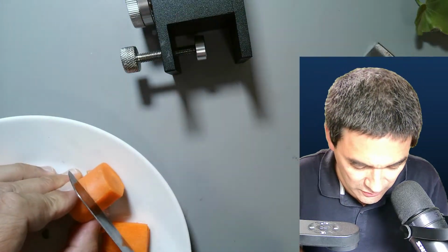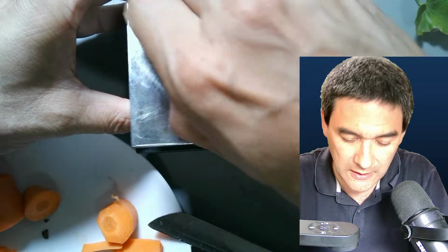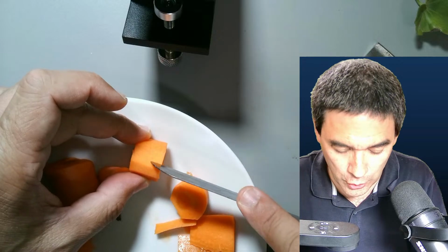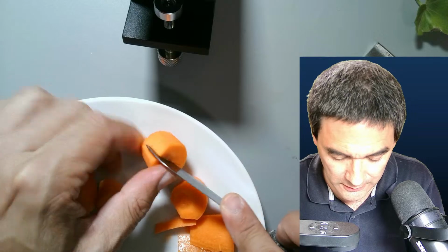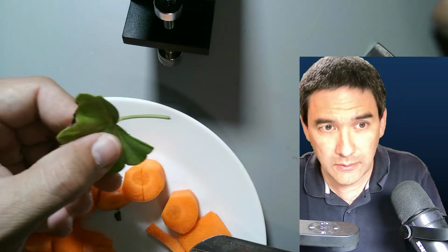Yeah, and as you see, if you start cutting it, you're kind of lifting it out as well. I'm going to use this here. So here we go. Okay, and another cut. Usually I just cut it halfway so that it's held together on the bottom. Yeah, it's just for added stability. Another leaf.